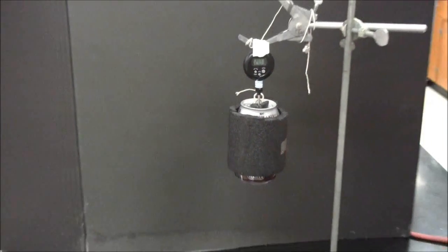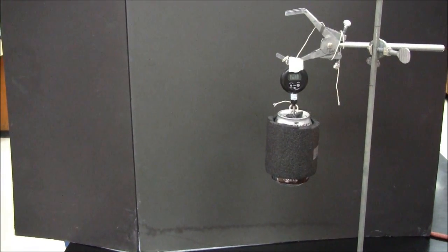Notice that I've blocked the top of the calorimeter to stop any evaporation.